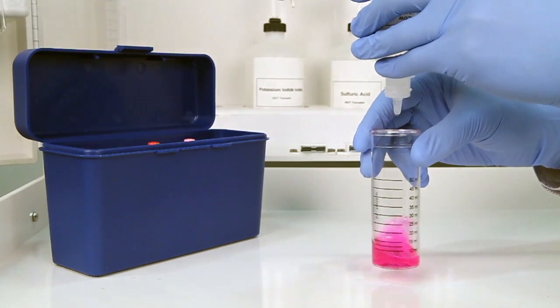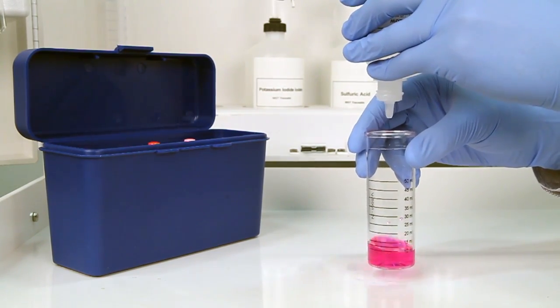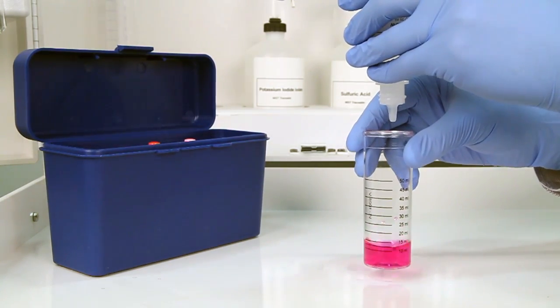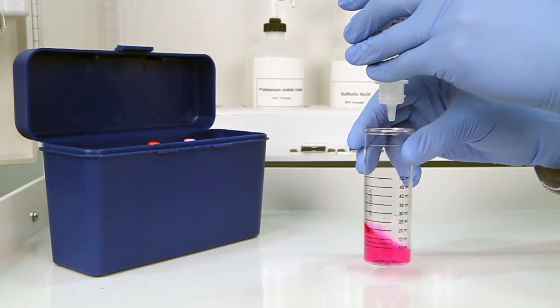It's important to make sure you have the proper titrant and the proper sample size for this titration. The bottle contains a dropper tip, so it's important to hold the bottle vertically to get a consistent drop size.